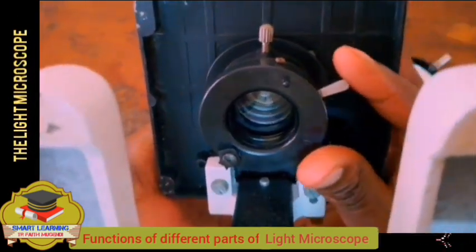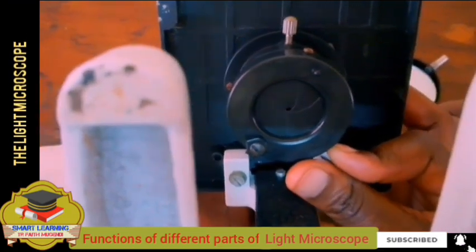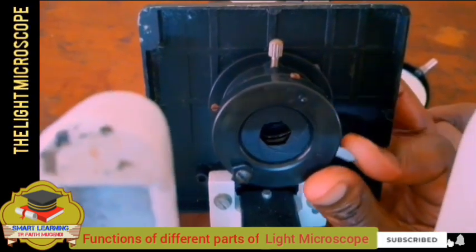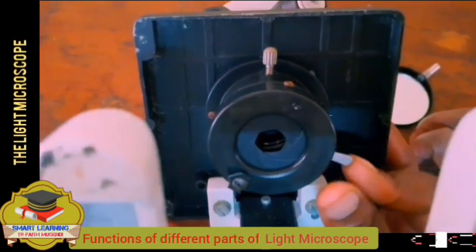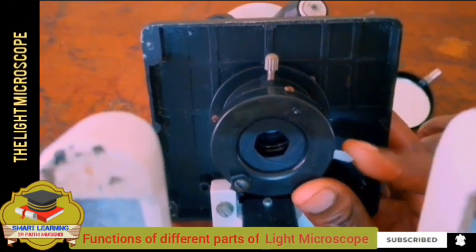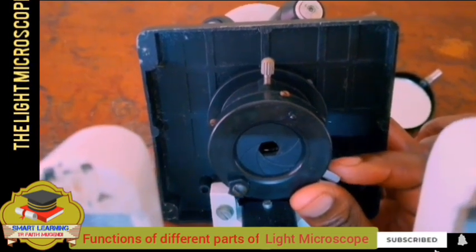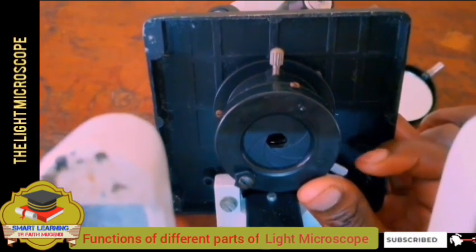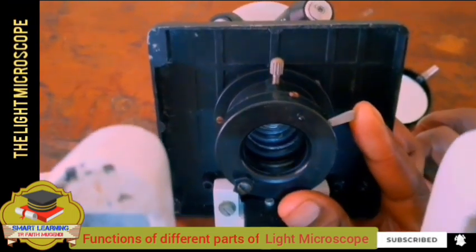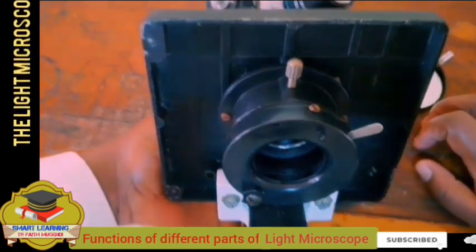And we can close and open it. Like now it is open, we can close it. We can open it. So its diameter can be regulated depending on the amount of light you want to reach the stage. If there is too much light, then you reduce the diameter so that we have little light, so that the stage will not be too much illuminated. If there is little light, then you make sure that the diaphragm is fully opened. I hope that is clear.